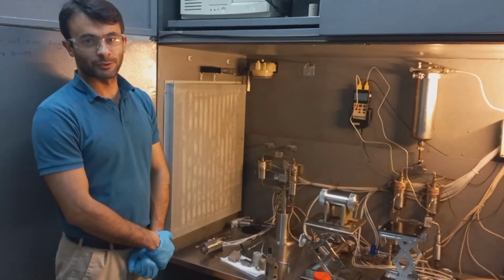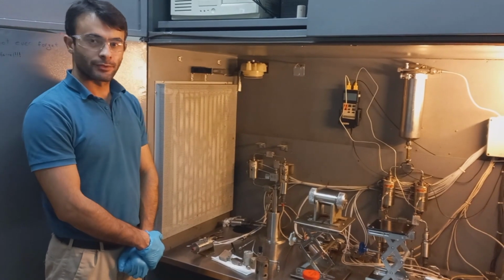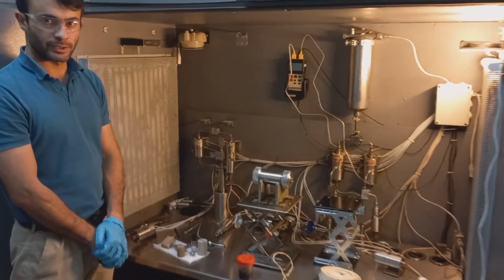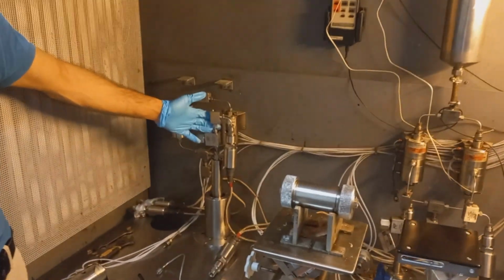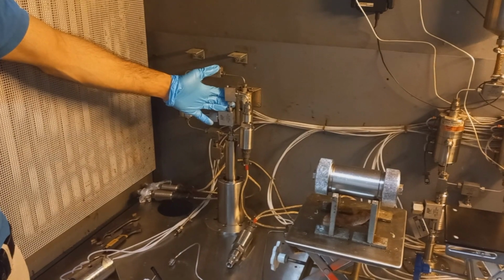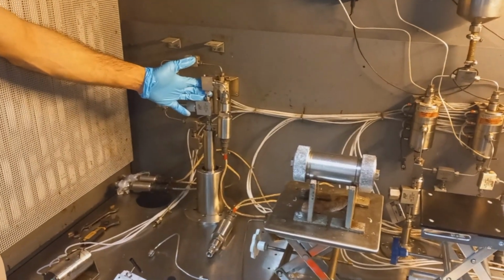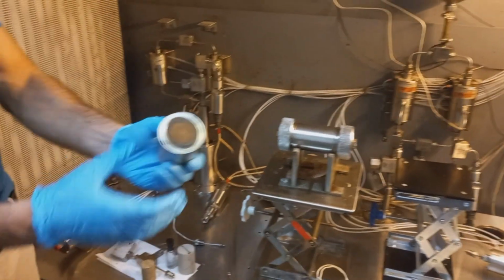In Satbayev University, we study enhanced oil recovery technologies. For this purpose, we use this equipment. The core fluid experiments are conducted by using this high-pressure piston pump, which can inject different fluids at a constant flow rate and at up to 400 bars into this core holder.